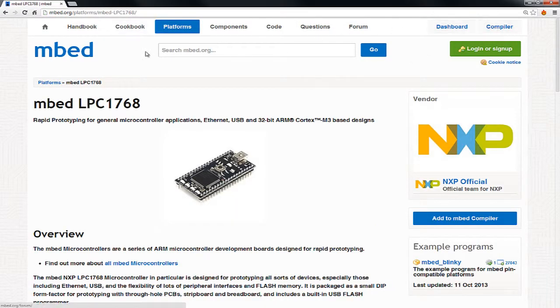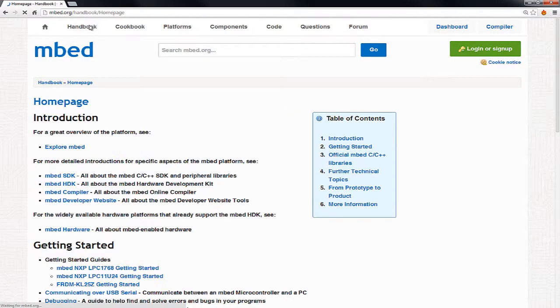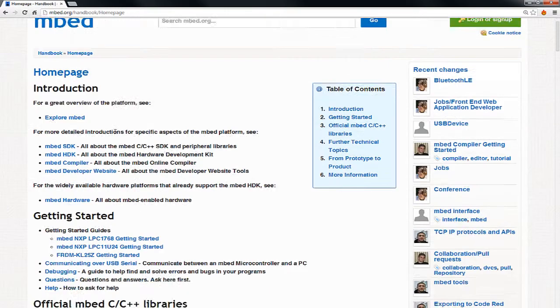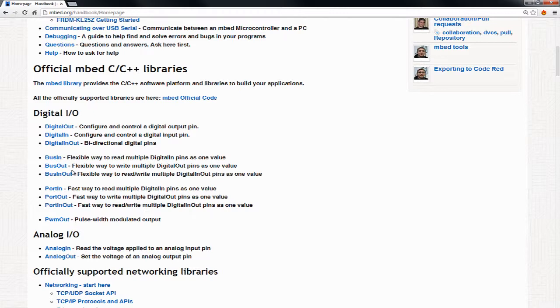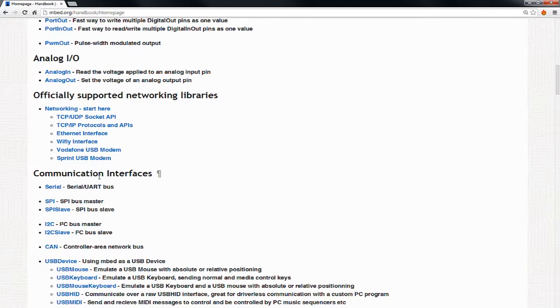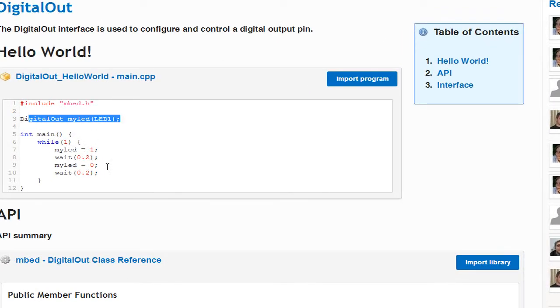Now, when I go to the platforms, one thing I'm going to show you, and the thing that made Mbed popular, is that a lot of the hardware programming was abstracted with nice C++ libraries. In the handbook section, they have examples of how you talk to basic stuff on the Mbed. For the Chem box, I've taken it a level further. There's lots of custom hardware where I used a lot of these functions, but all you have to do is make simple function calls. For example, a digital out object is really easy to declare and use. Their Blinky example, whenever you create a new program, shows you that. That was the nice thing about Mbed.